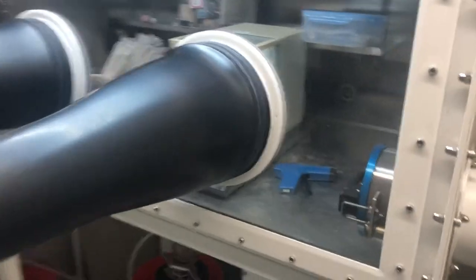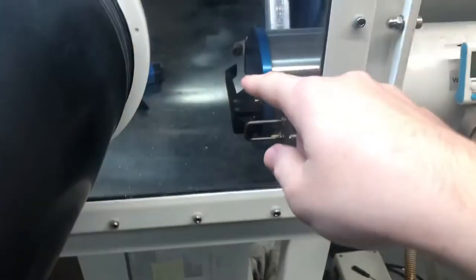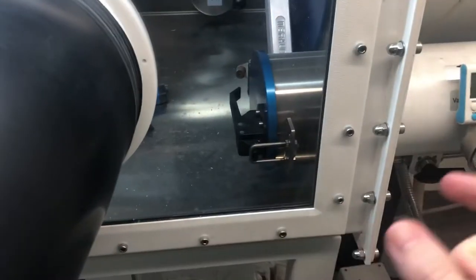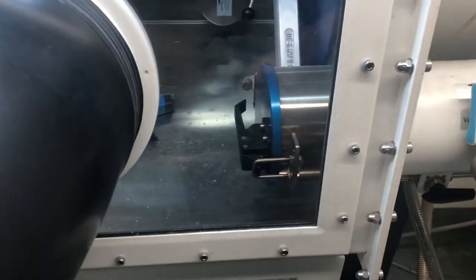And when you're working in the glove box, when this is not under vacuum, you can pull this lever, swing the door open, pull the tray out, grab your stuff quickly, bring it in, and then shut the door and lock it shut.